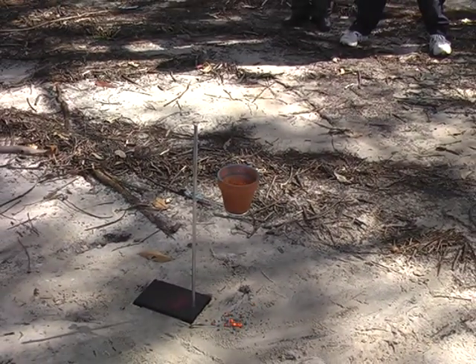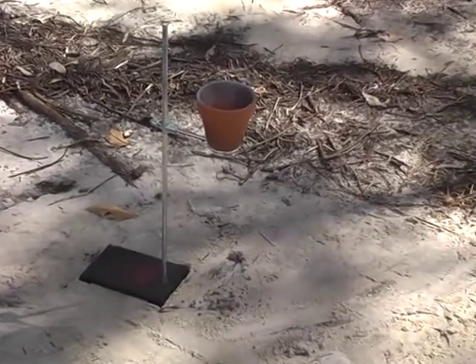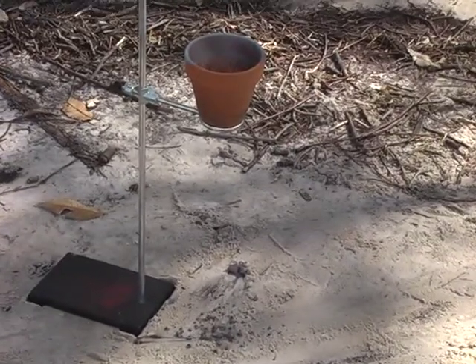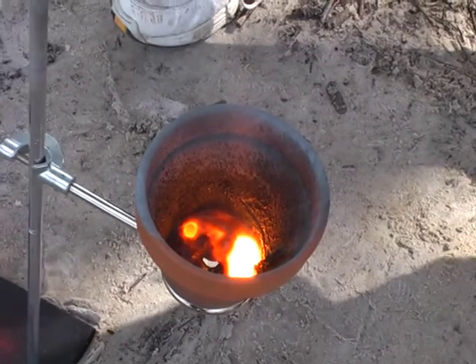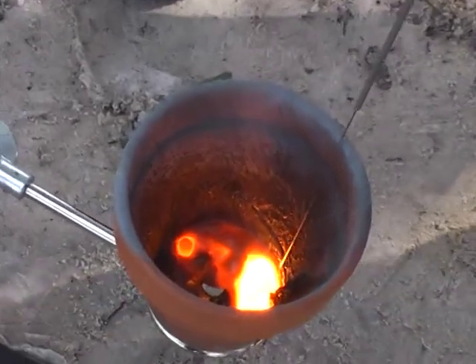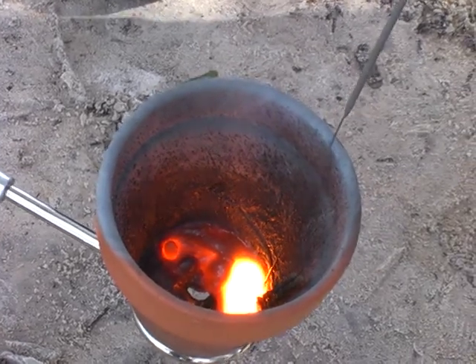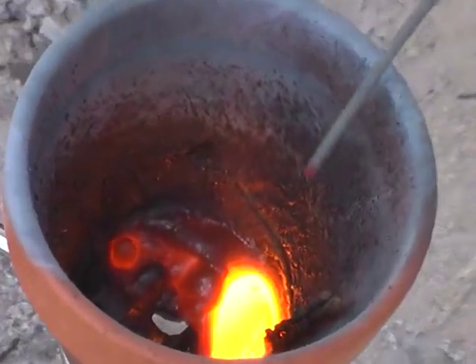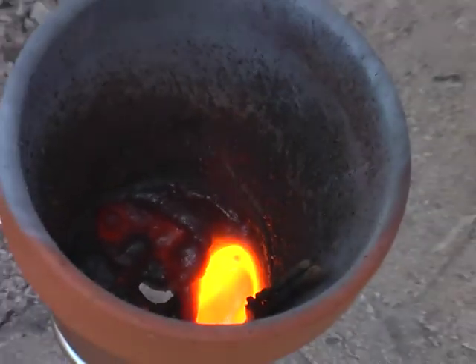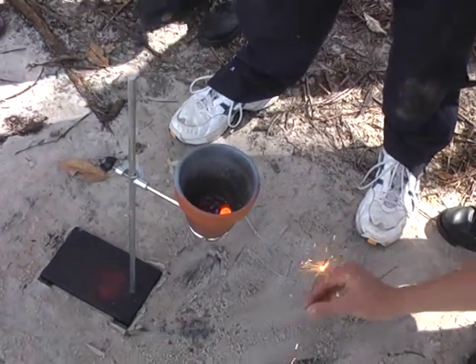That indicates the massive amount of heat. What a fizzle. Come in close and have a look on top. It's fine. You got all the molten iron — that's liquid, isn't it? Everyone gets the idea. Yeah, liquid iron. That's what you can see — the amount of heat there. It'll take a while to cool down, believe me. A lot of the iron actually came out. But we did lose that pot, Miss Fitzpatrick.